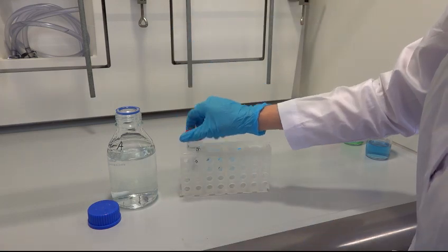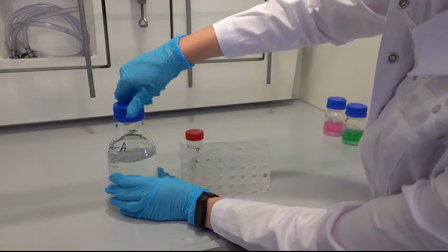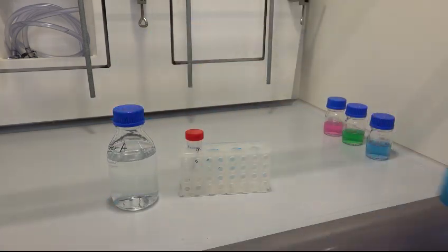Close the tube and mix it by placing one finger on the cap and moving it upside down several times.